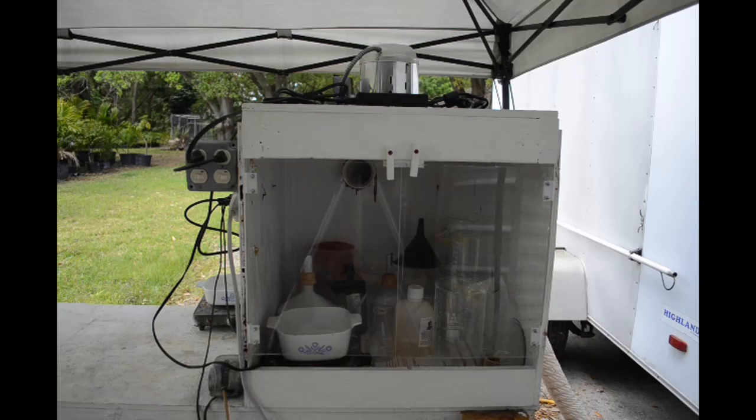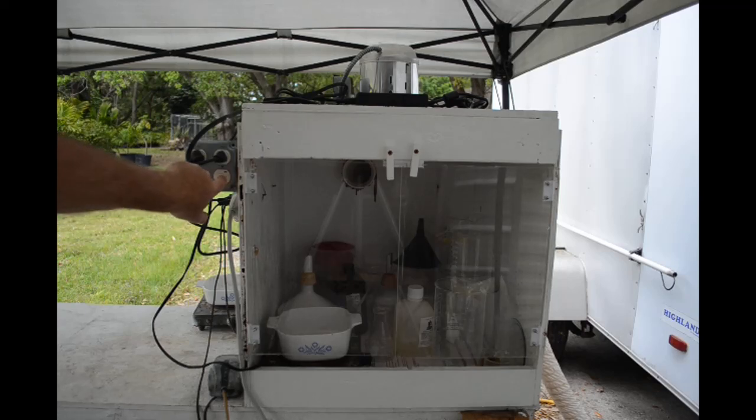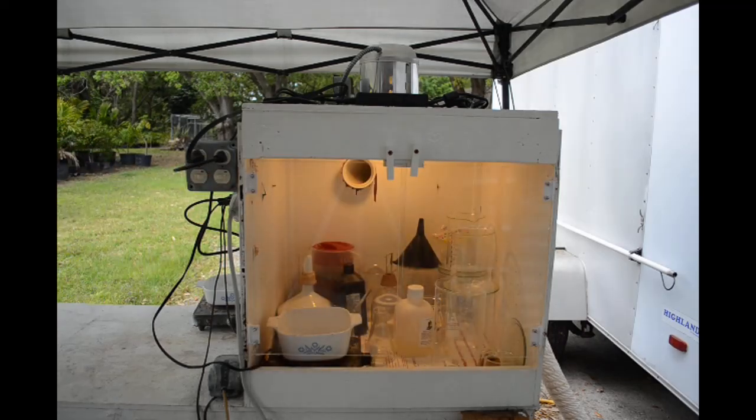With the new doors you'll be able to see inside better when I'm doing stuff. I'll be able to film inside it better. But speaking of seeing inside, check that out - I got the lighting working again.